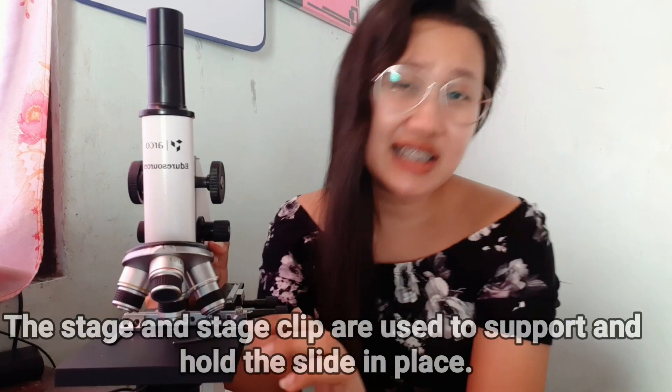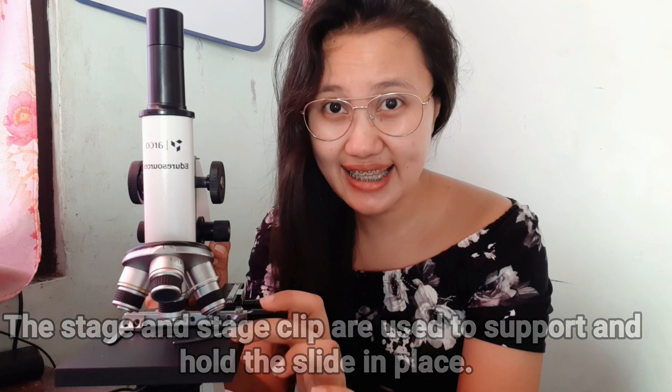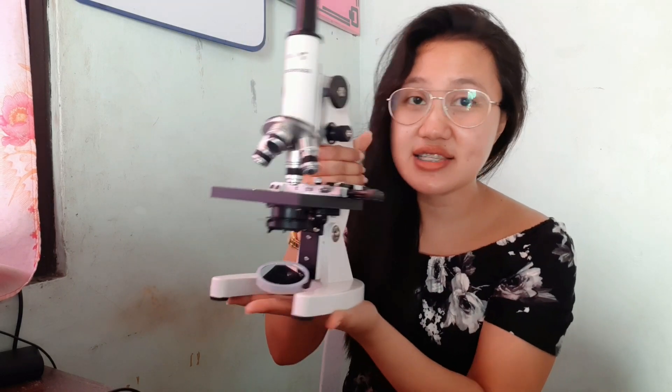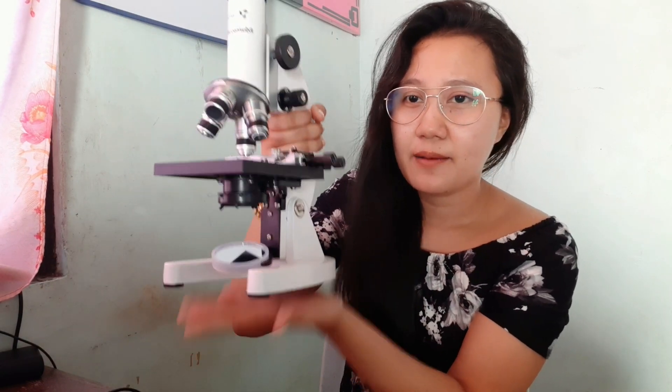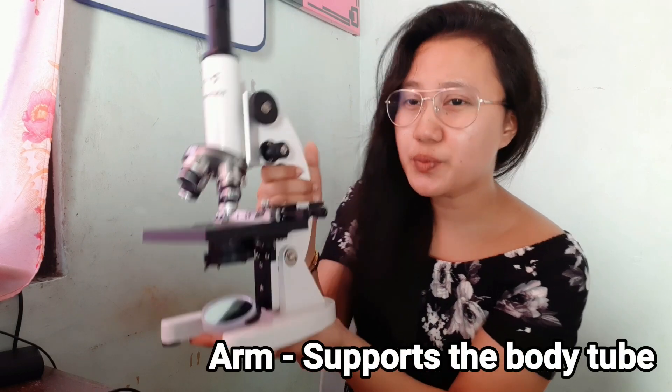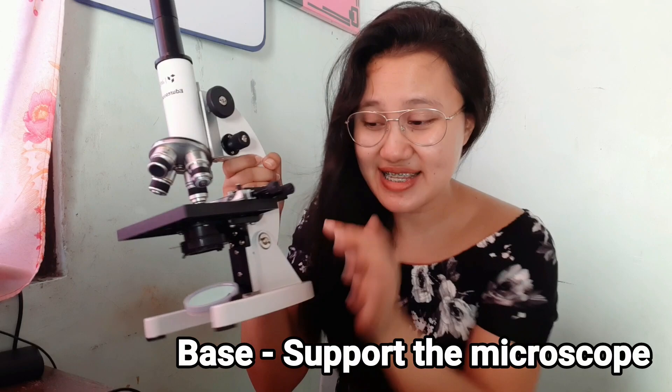Aside from that, we also have the stage and the stage clip. The stage and stage clip hold and support the slide. We also have the arm and the base. The arm is what you hold when carrying the microscope — you hold the arm and the base. The arm supports the tube and connects it to the base.